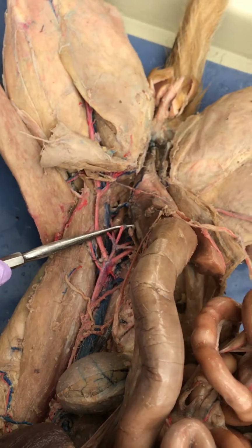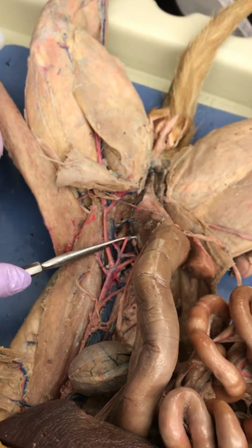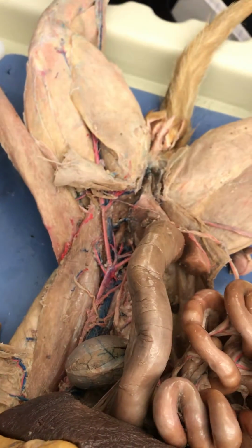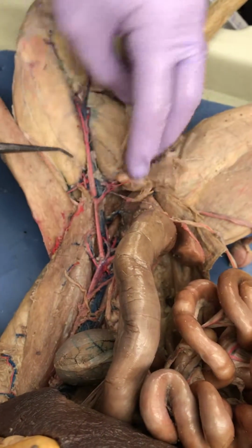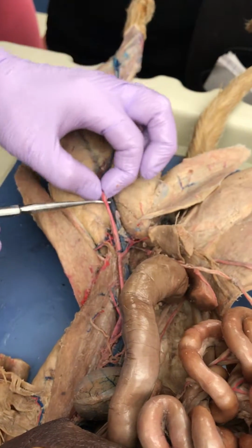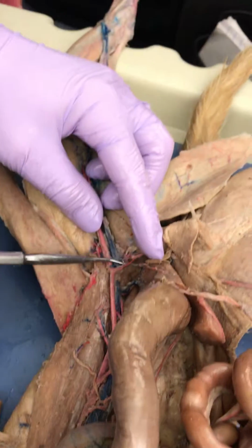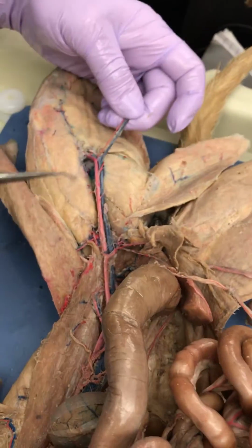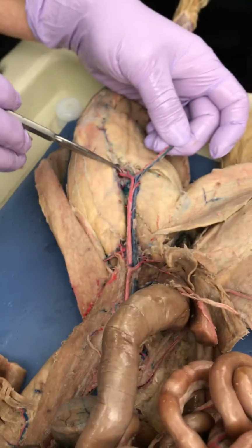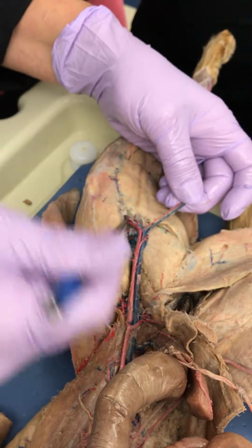Caudal. See, once you dig in there, it starts getting loose and it's easier to see stuff. You may remember your first day it was in there so tight. So now it's easy to see that. Okay, so then the external iliac goes into the leg, so now we call it the femoral. And what about this one? Deep femoral. And then I'm going to pull and it disappears. There's a nice view. Look how big it is, Harley. See that? What is that? Goes into the back of the knee.